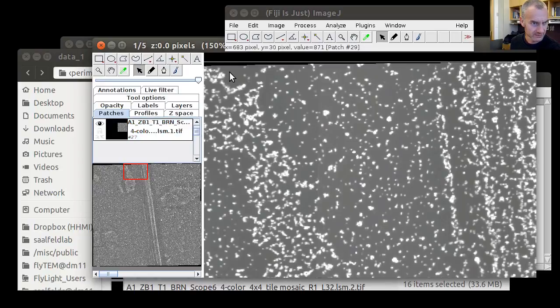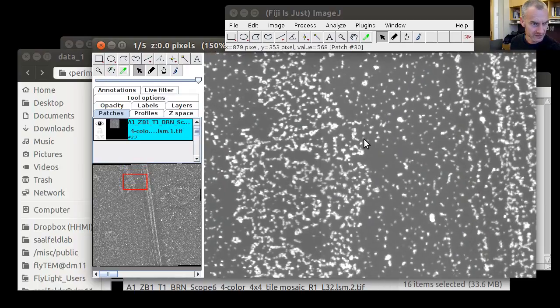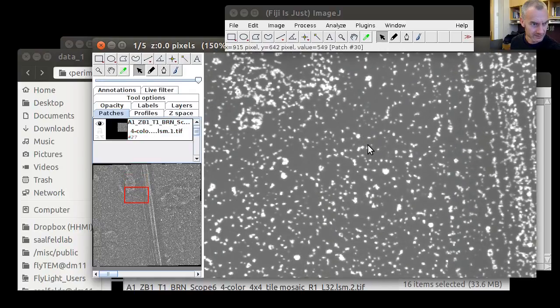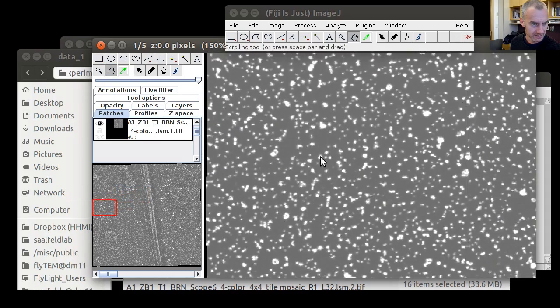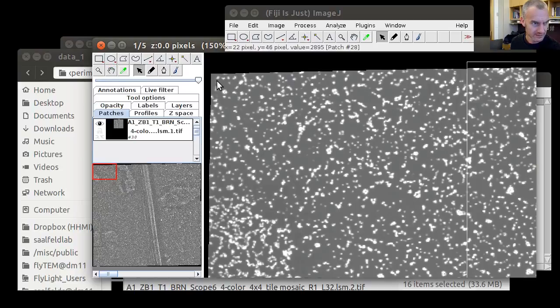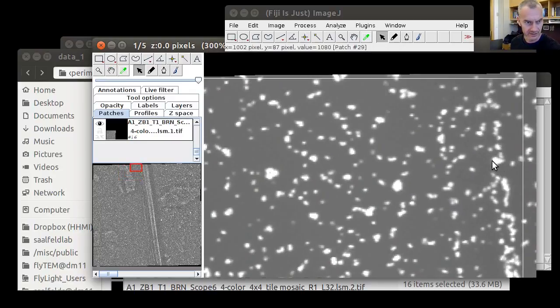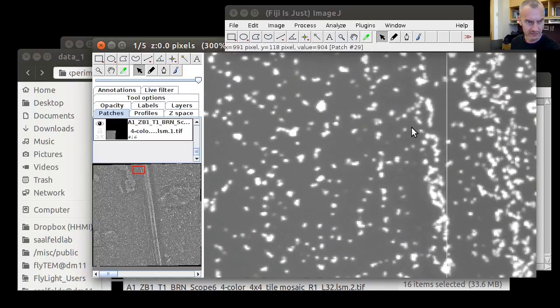So I'm clicking this tile, and then I move it up and down. And so I was probably confused by the fact that it looks really almost the same. It does so across the entire field of view. And that's actually the situation that we were hoping for. So take this one, bring it up and down. So even in the very periphery of images, the overlap is accurate, almost accurate, so accurate in the subpixel regime.